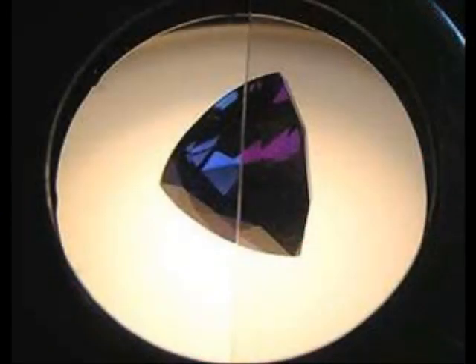Another property indicative of anisotropic materials is pleochroism. Pleochroism is when the anisotropic sample changes colors when it is rotated due to absorption of particular wavelengths of light. The color seen is a function of the thickness, chemical, and crystallographic nature of the material. This picture is a comparison of a material that exhibits pleochroism. Under cross polars at one angle, the gem is blue, but after rotation, it is purple.